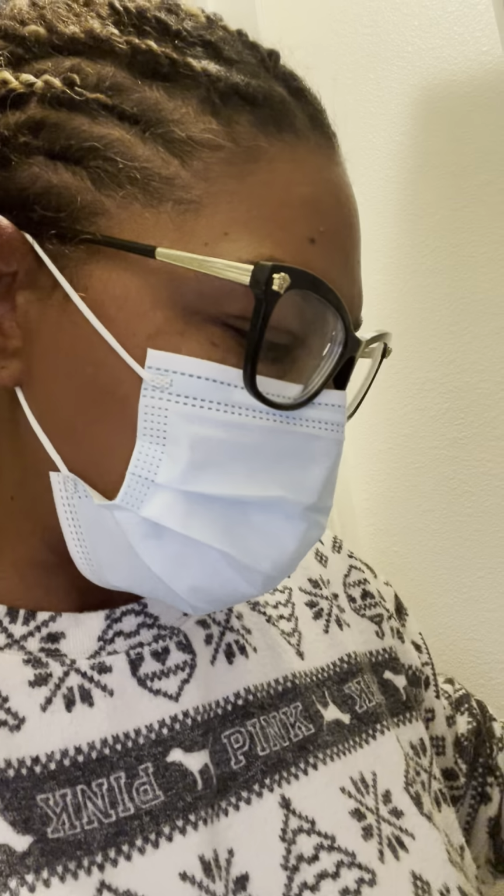Not too much growth like I was expecting. The temperature is fine in my house. I'm not too sure what happened. I followed the instructions as best I could, so I'm not too happy about what the E. coli looks like in the Petri plates.